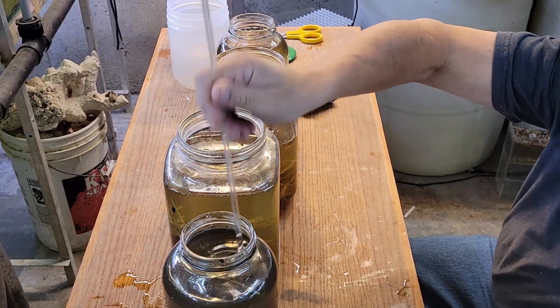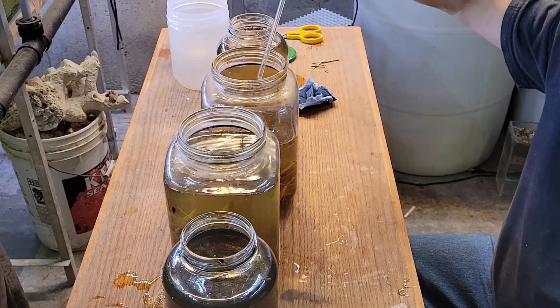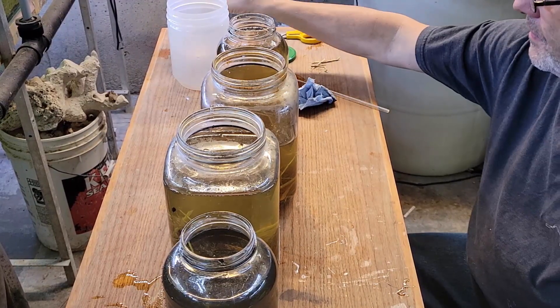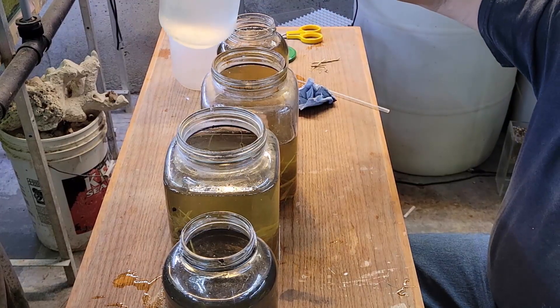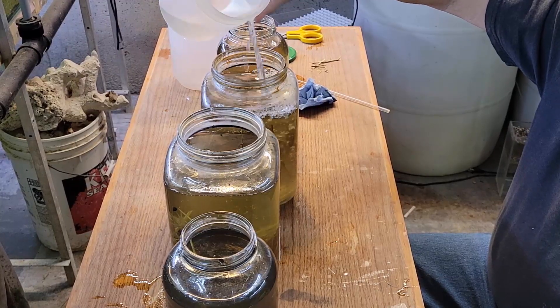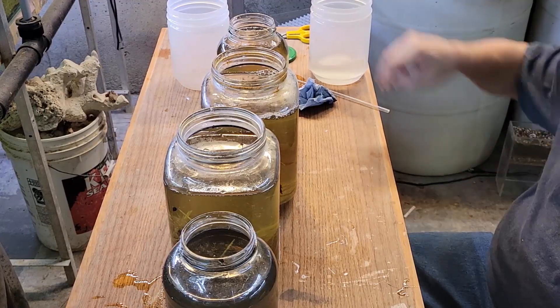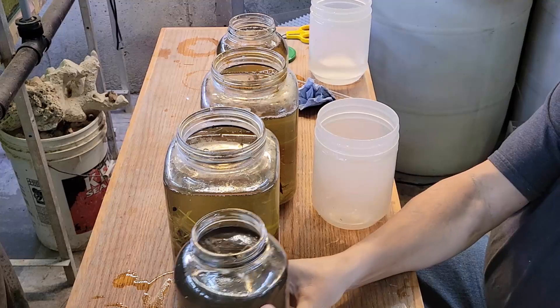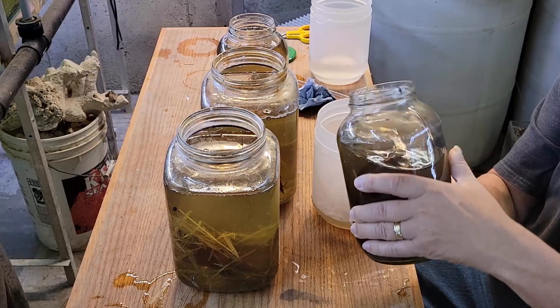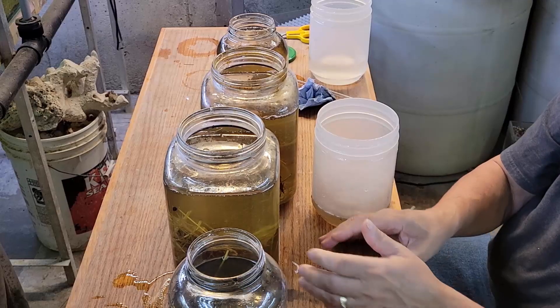What I've done is I took a bit of the old organic material from one of the cultures and put it into the one I subcultured to. Basically what it is: I poured water containing paramecia from all the other containers into that one, and then topped it up with a bit of fresh. And then what I'm going to do on top of that is add in some new hay, because that's important, and the amount of it is the question mark. I just add a little bit at a time and then watch for the result.